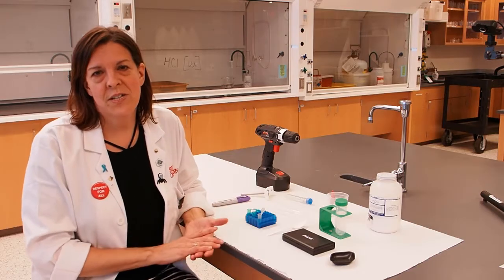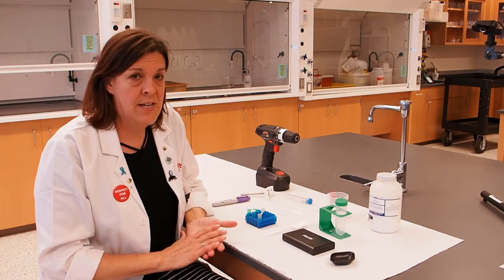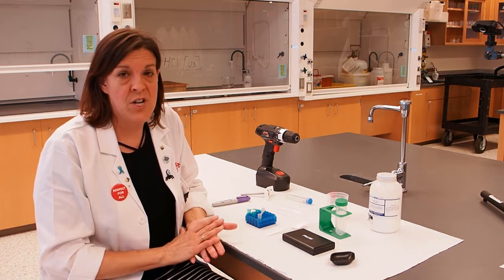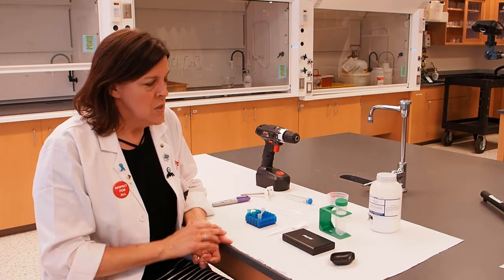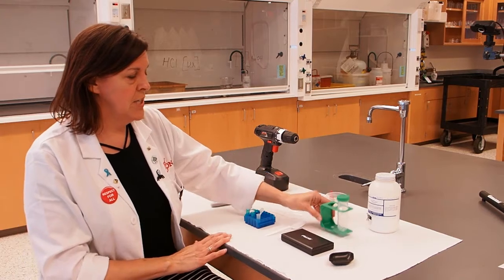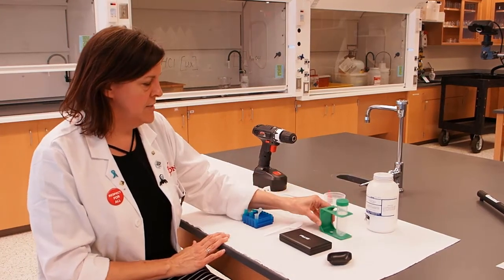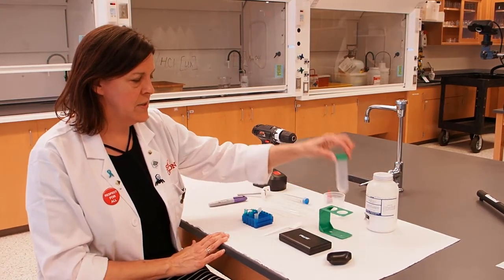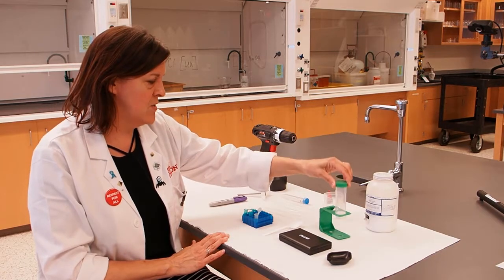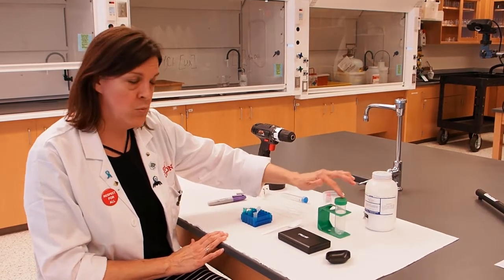The materials you need for this activity are found in activity bag number eight and the general lab supplies bag. From the general lab supplies bag you're going to need your cool test tube rack with the large 50 milliliter test tube in it. You're only going to need one of those.